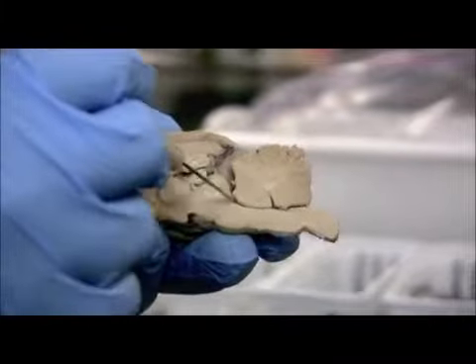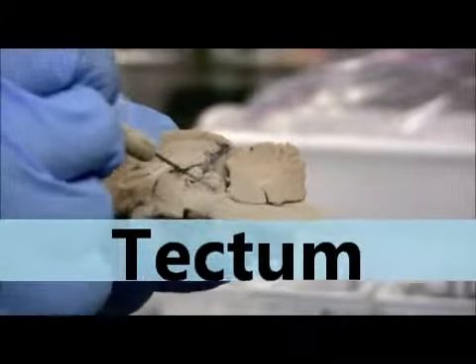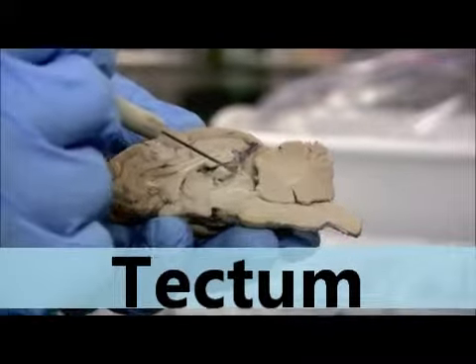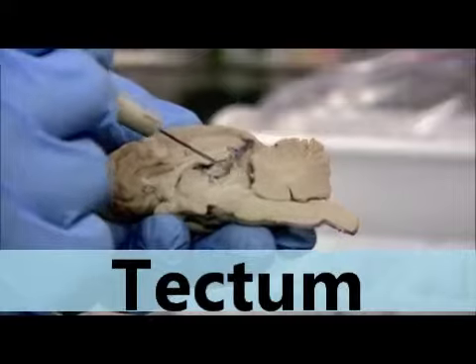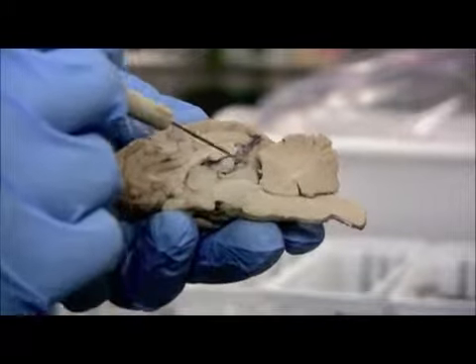The canal, as it comes up, you can see this is where those corpora quadrigemina are in this mid-sagittal view that you're looking at down the center cut. This is the superior colliculus and the inferior colliculus. Remember, that's the singular version of colliculi.